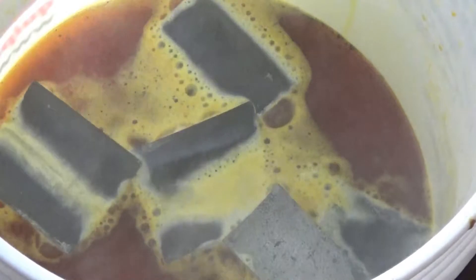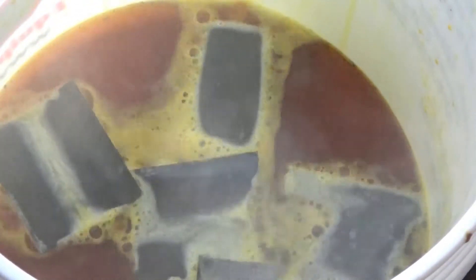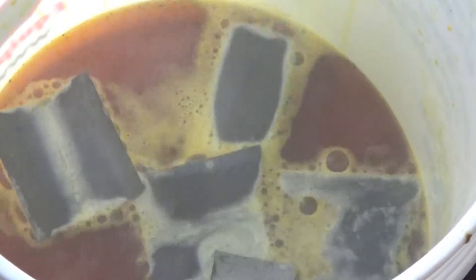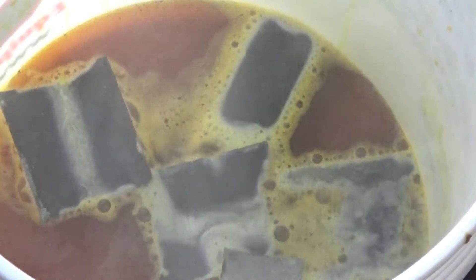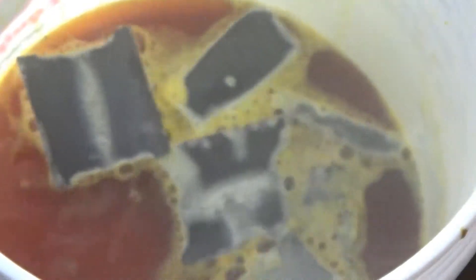This is the chloride. We dropped the zinc strips in. This is that three pounds of Telluride ore, supposedly. We just now put the zinc strips in it, so you can see what it's doing.